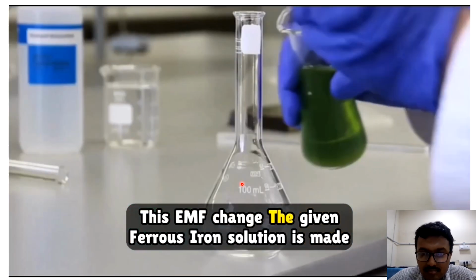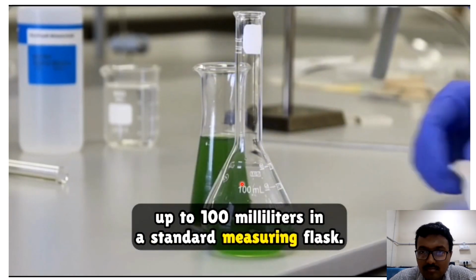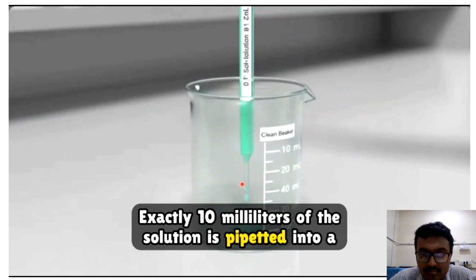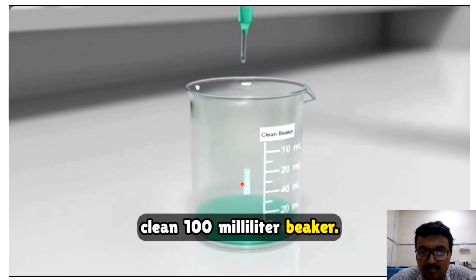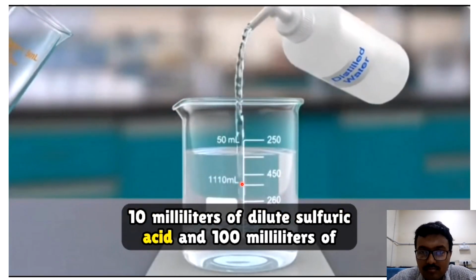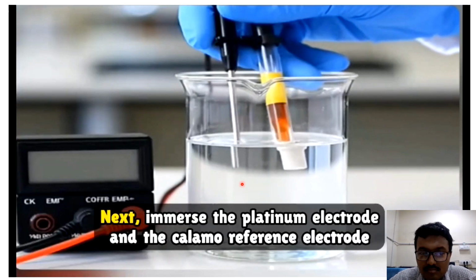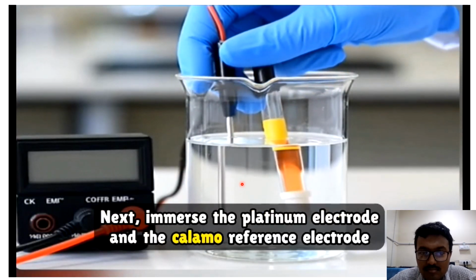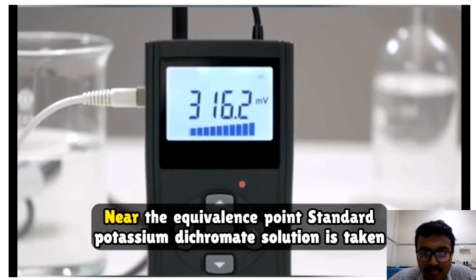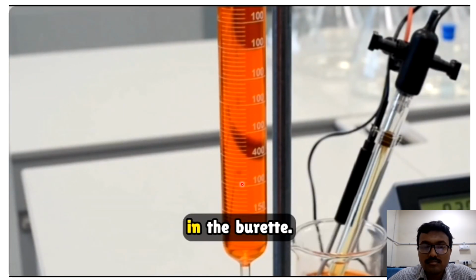This EMF change is measured. The given ferrous iron solution is made up to 100 milliliters in a standard measuring flask. Exactly 10 milliliters of the solution is pipetted into a clean 100 milliliter beaker. 10 milliliters of dilute sulfuric acid and 100 milliliters of distilled water are added. Next, immerse the platinum electrode and the calomel reference electrode into the solution and connect them to the potentiometer. Standard potassium dichromate solution is taken in the burette.